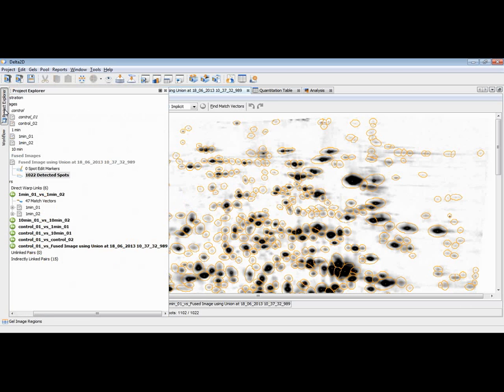So for example, we would maybe delete very weak spots, maybe like this one or this one or this one. I can now choose them and select them one by one and press the delete key to get rid of them. I could also open a certain table to select for a certain spot quality.